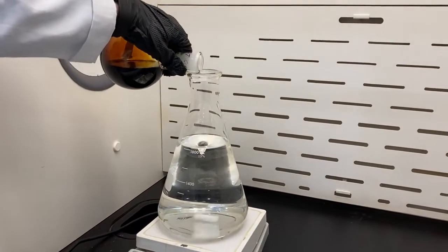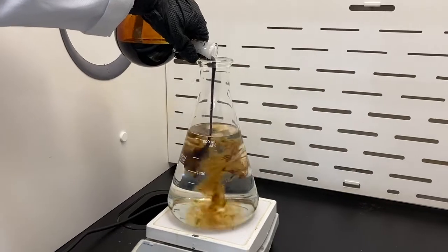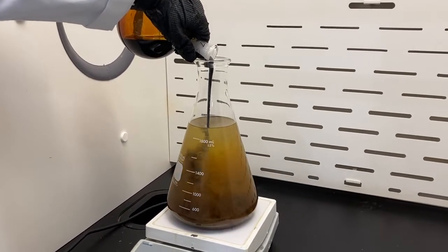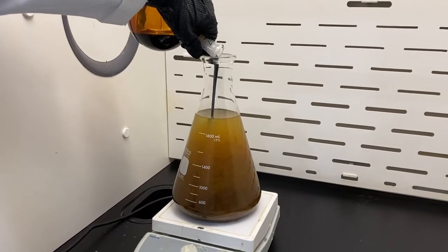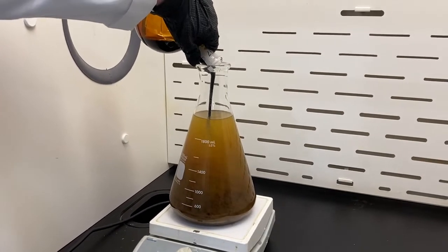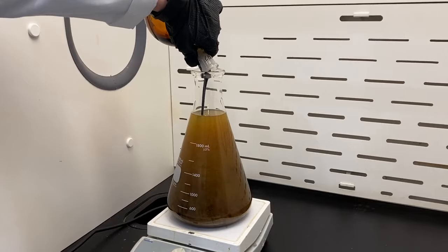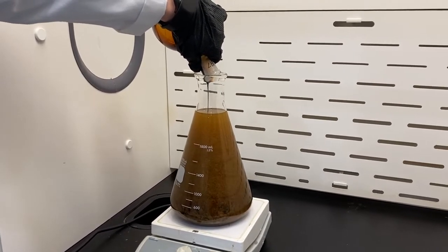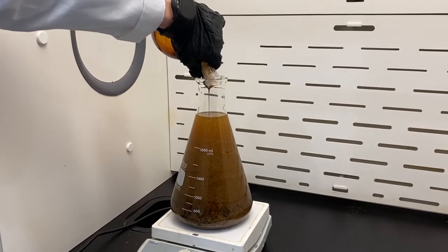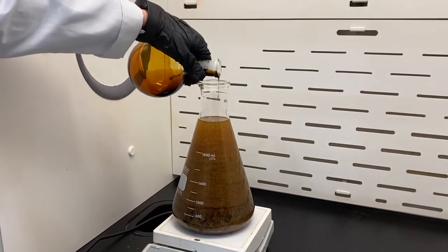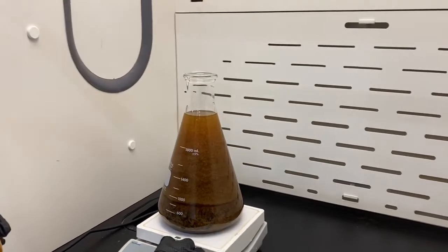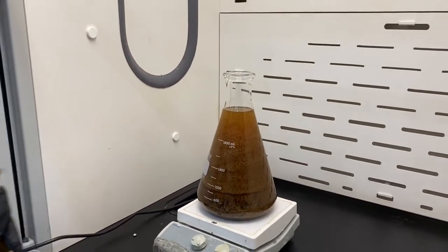I had a bead there. Let's go ahead and dump her in. We're going to have a little bit of transfer loss here in this round bottom, but we're going to just get it as good as we can and then leave it alone from there. All righty, good enough. Let's go ahead and turn the stir bar up a little bit just so we can get it moving.